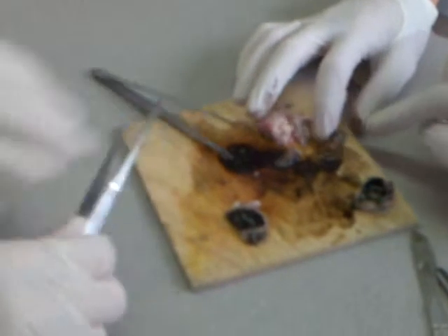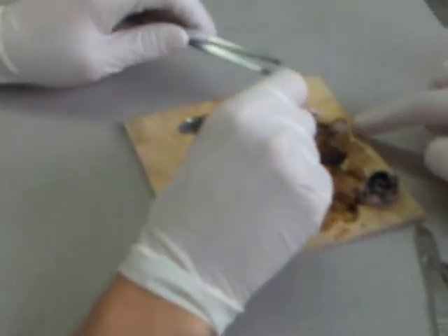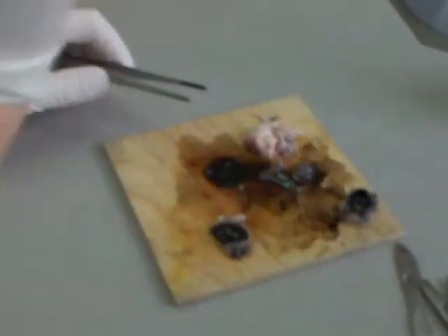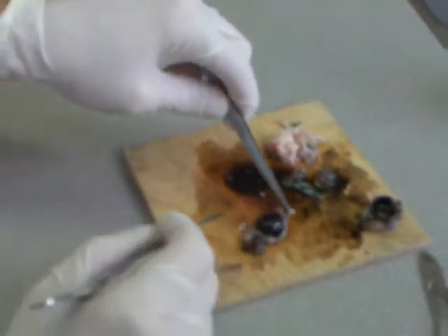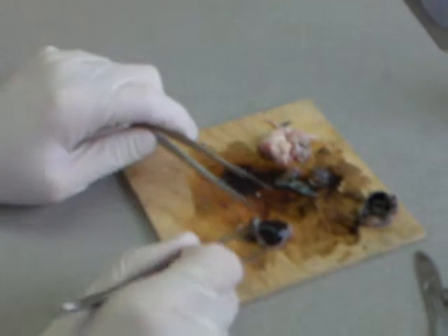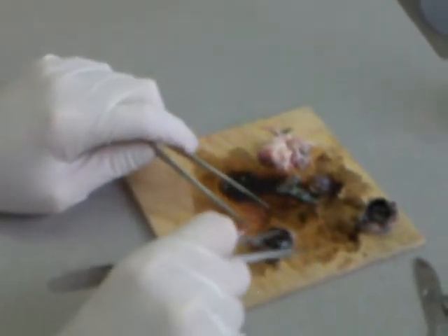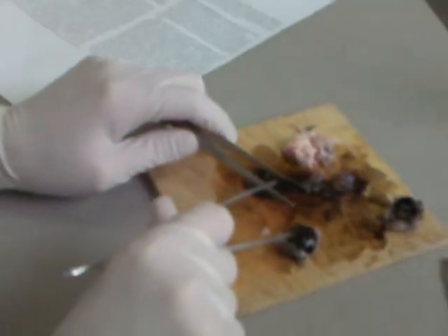With the other piece, we can see this was like a lupa — a magnifying glass. That's the front of the eye and then we've got the back of the eye. There's the inside layer — that's the retina. Because it's been frozen, it's in a bad state. All the layers are coming away from it. You can't really see the fovea here, although possibly that's it. And you can see where the optic nerve leaves the back of the eyeball.